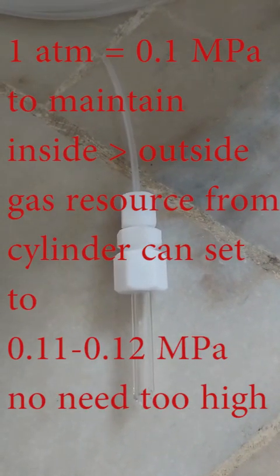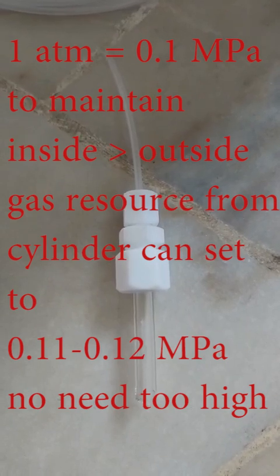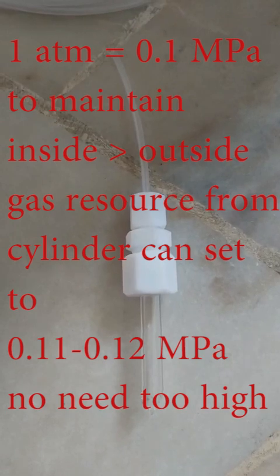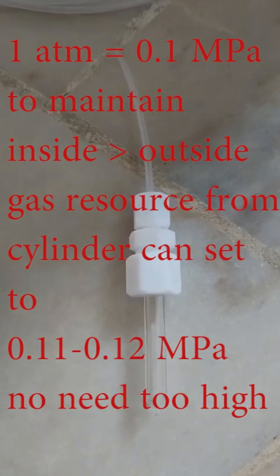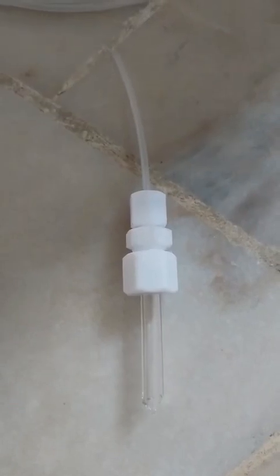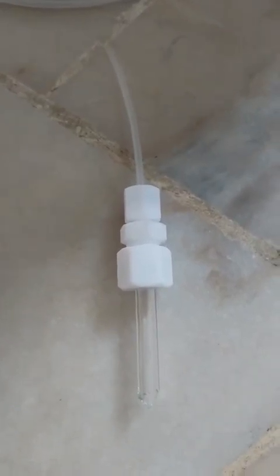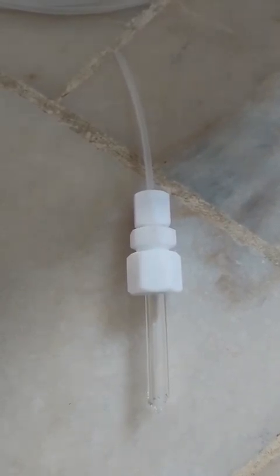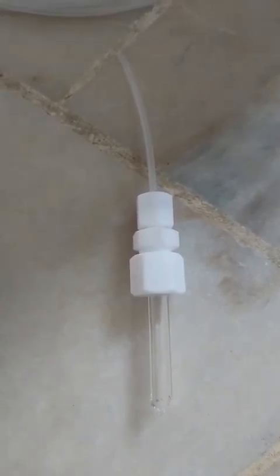Your target is controlled by the flow rate. So as long as your device can provide the flow rate with constant measuring indicated by the flow meter, you don't need to control the pressure inside the system, because the pressure inside provides the flow that can overcome the atmosphere.